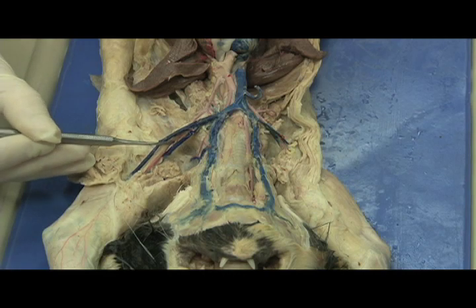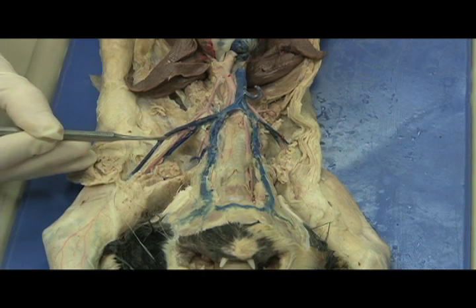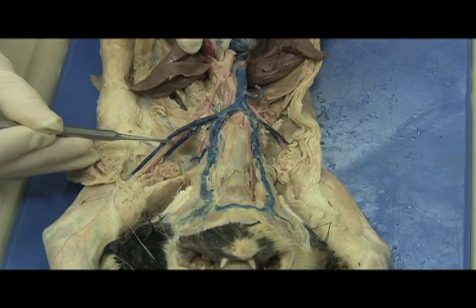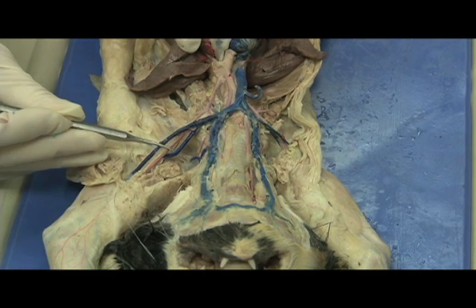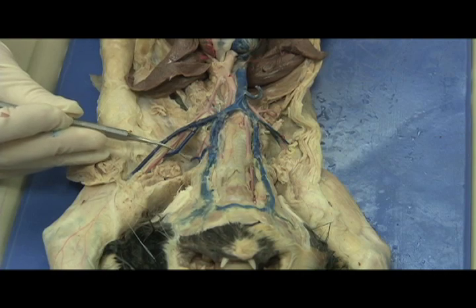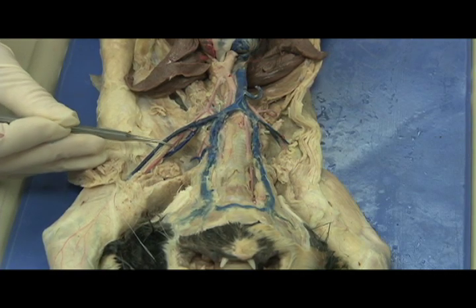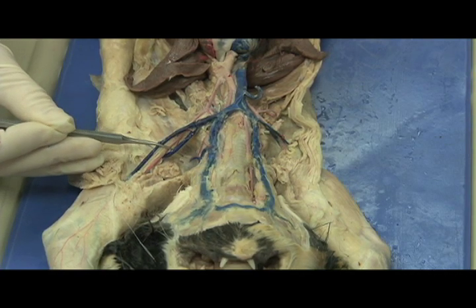This is the subscapular vein, which will drain blood from the scapular area and merge into the subclavian vein.